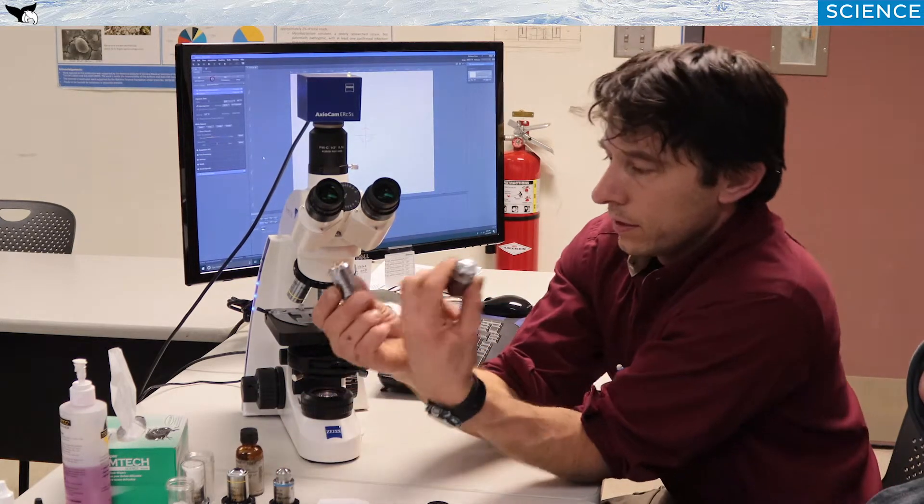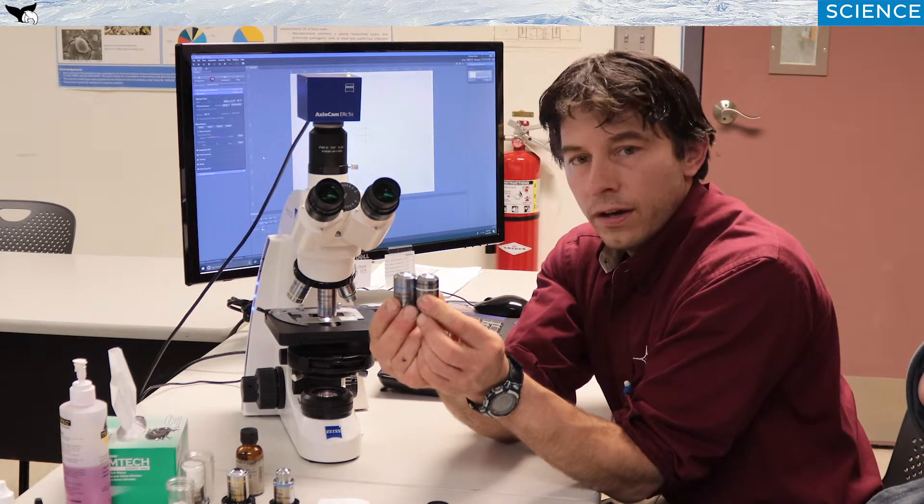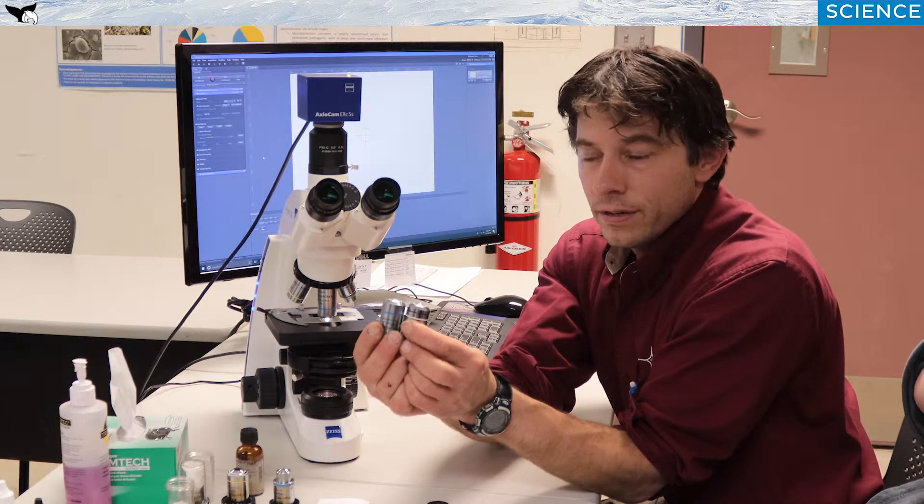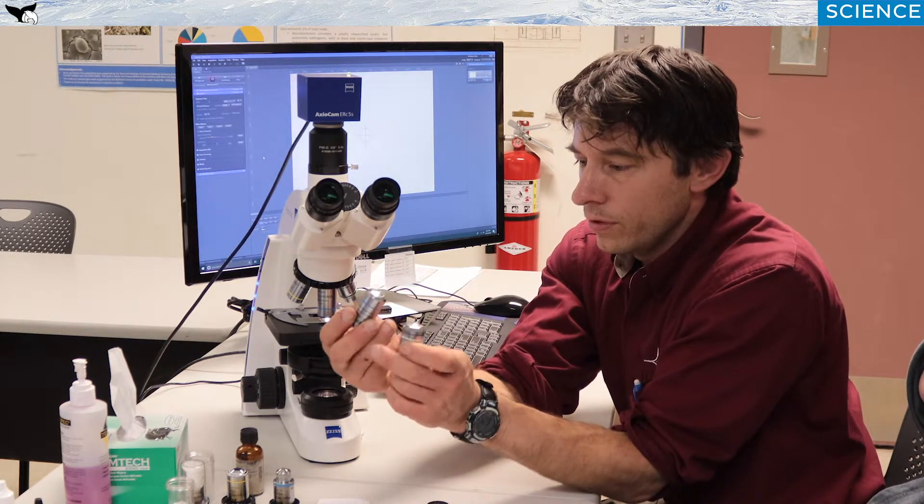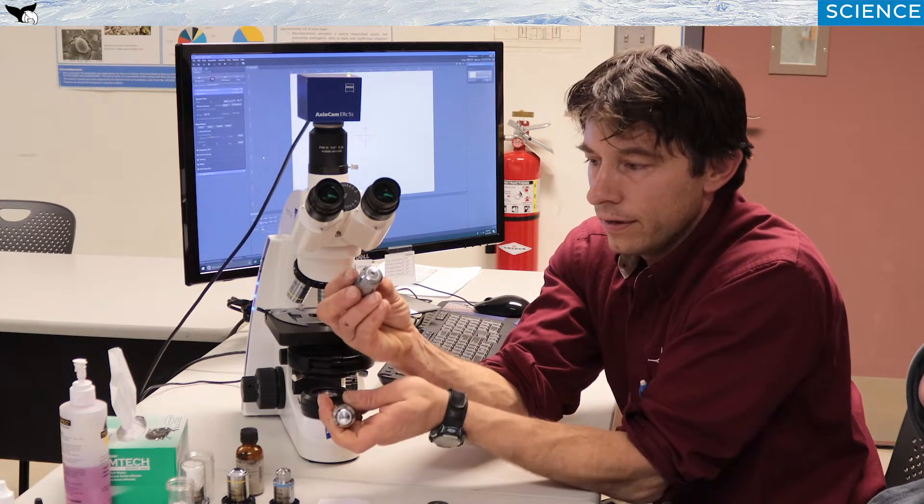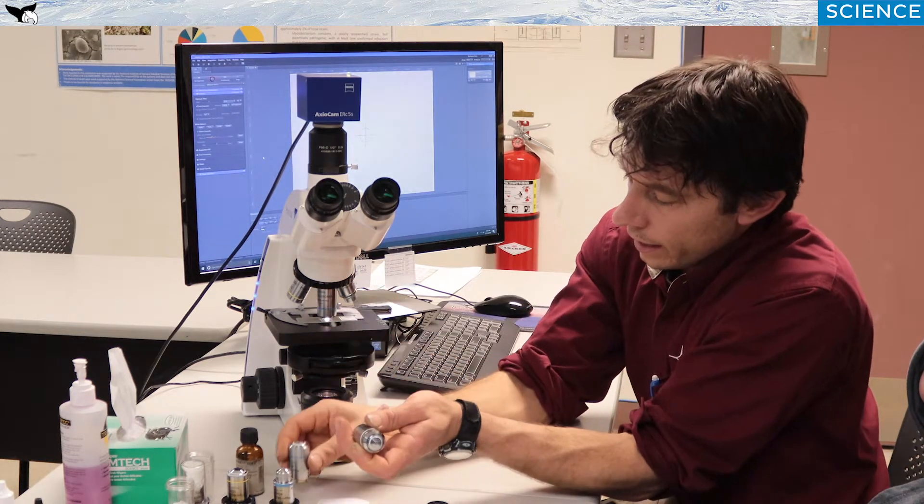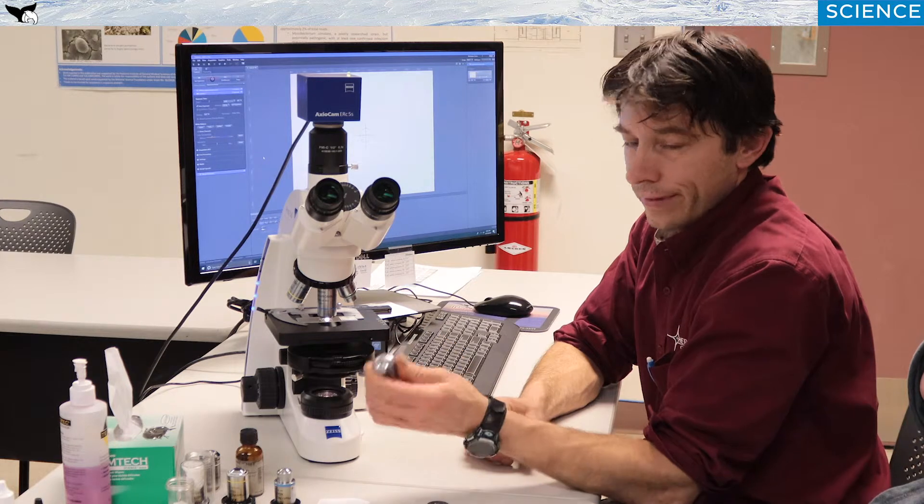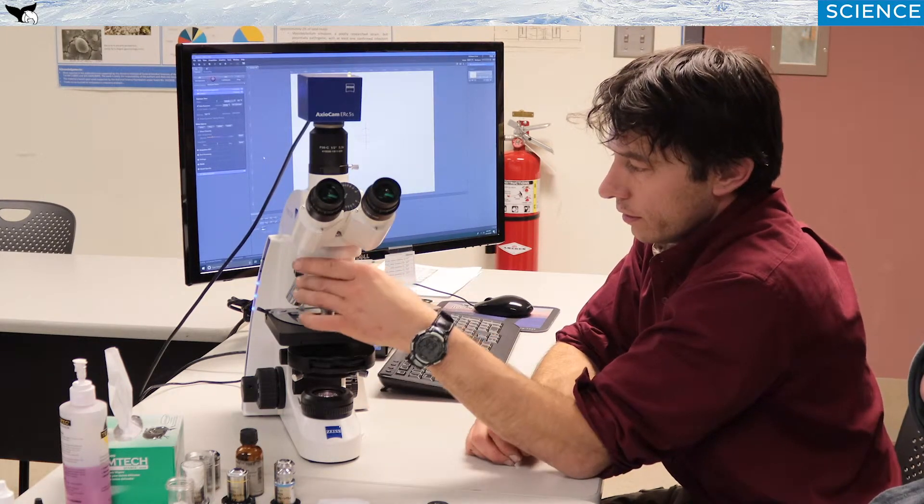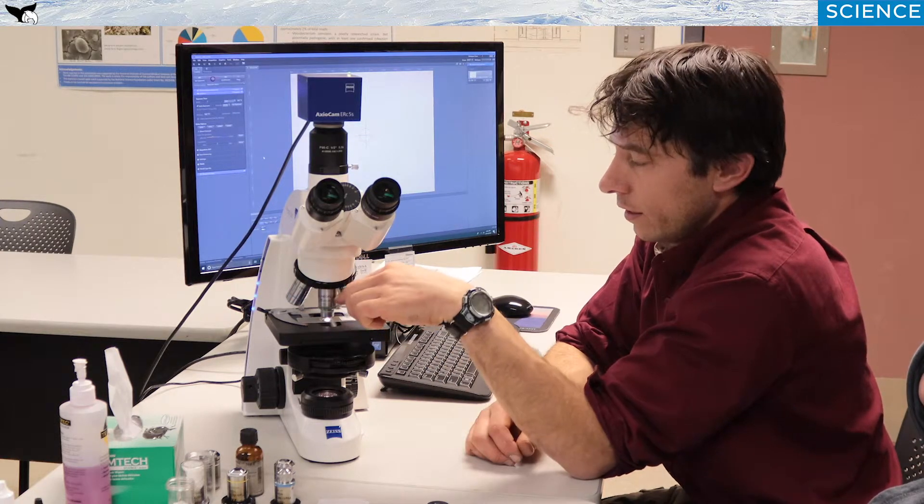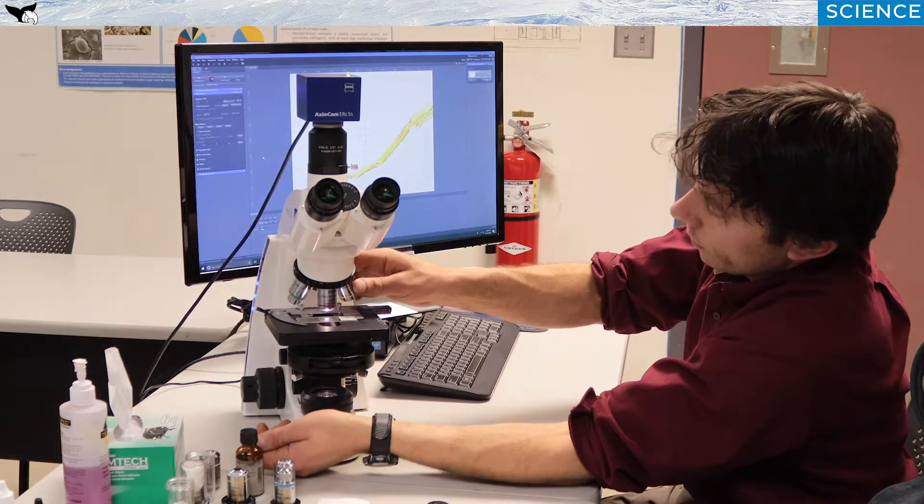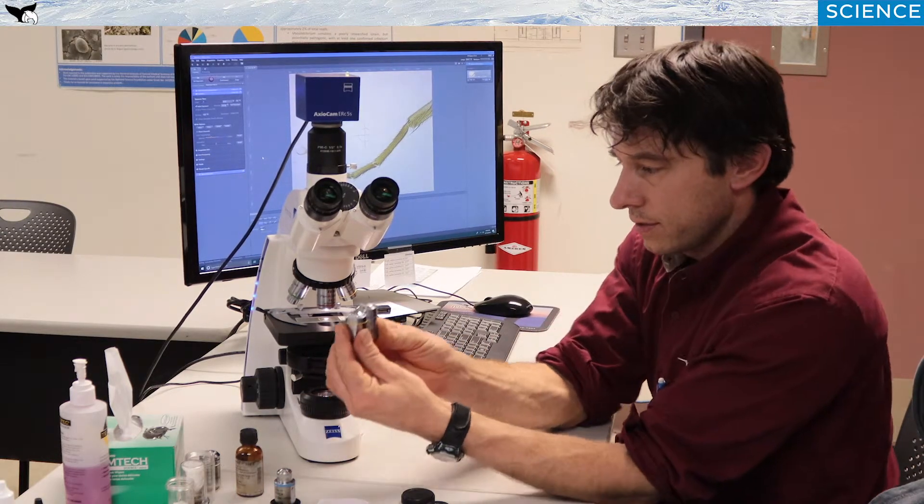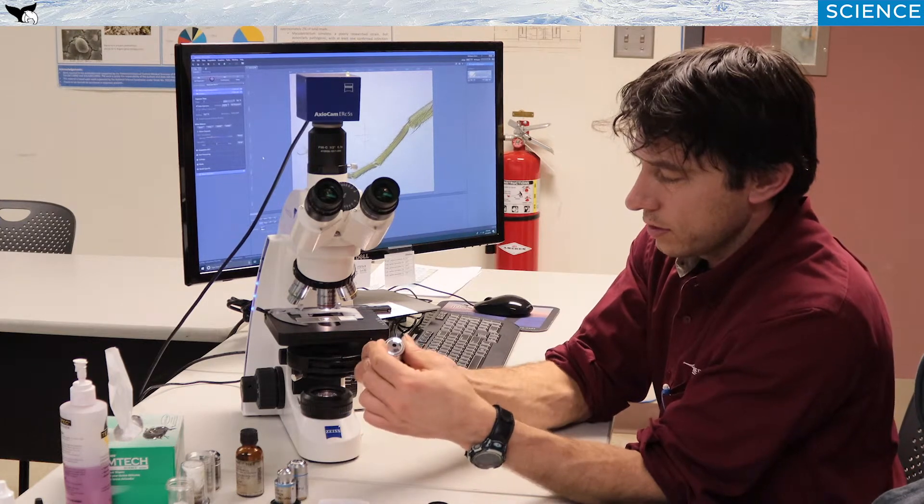The problem is 40x is very similar in height to the 100x. And probably the most common form of degradation of an image is that the 40x will get some of that oil from use in the 100x accidentally on the tip of that glass. And it's a really small piece of glass there. And you'll get a kind of a fuzzy wavy image. And you'll have to pull this off and clean that frontal lens. If there is a 20x, which I have on here just for show purposes, is also a very long objective. Rarely do you ever get oil on a 10x or a 4x. And the reason being is they're a shorter distance to each other. And so you typically don't get oil on those unless it's splattered up.